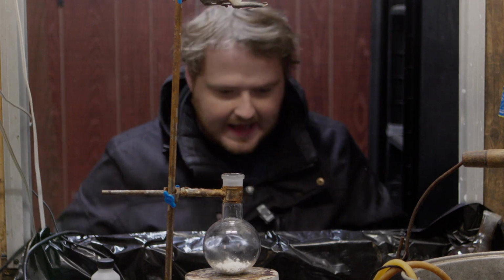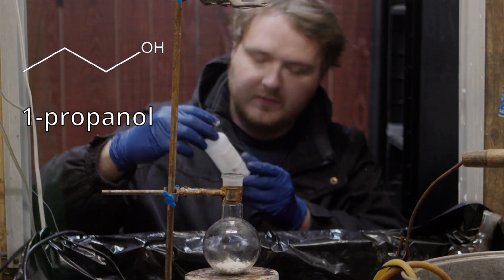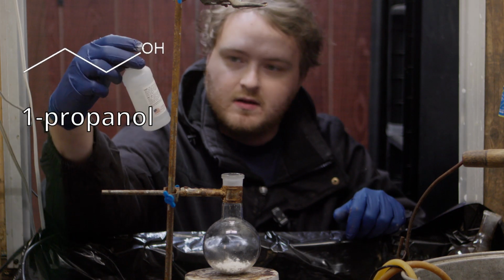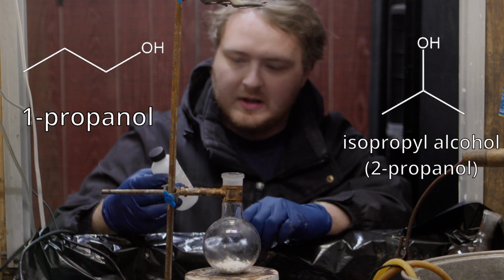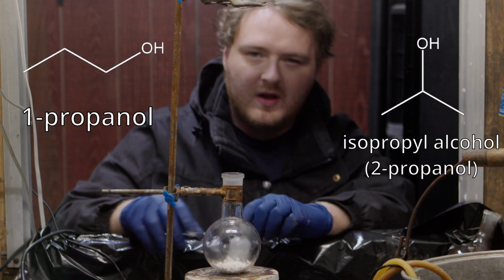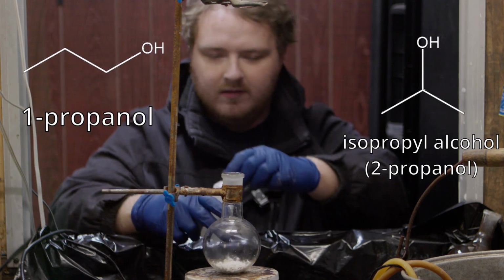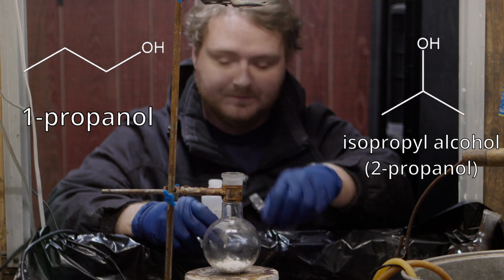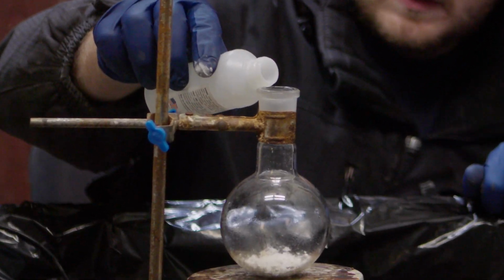Then we're going to go ahead and add 1-propanol. This is also known as propyl alcohol. It's like isopropyl alcohol that you may see at the store, but instead of the alcohol being in the middle, it's on the end. Not the same thing.